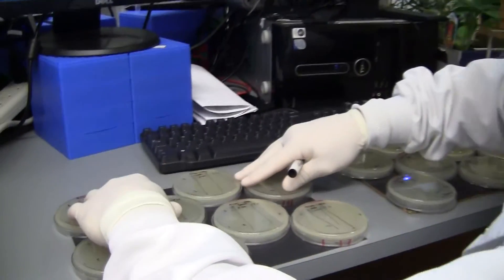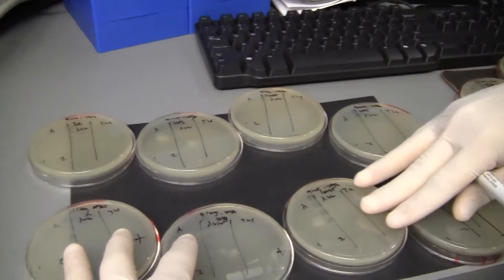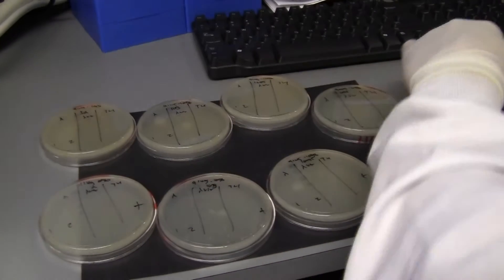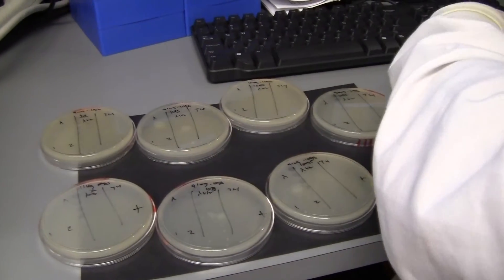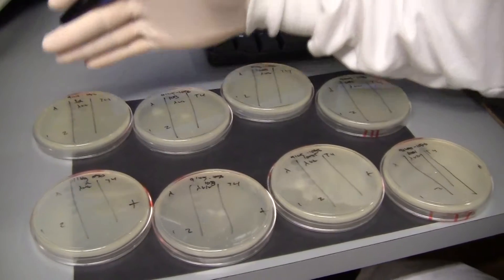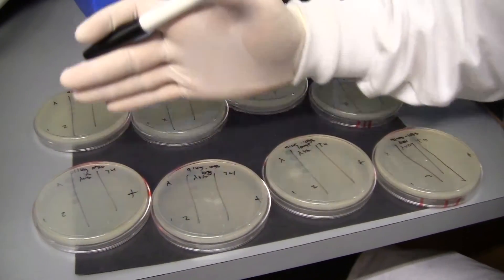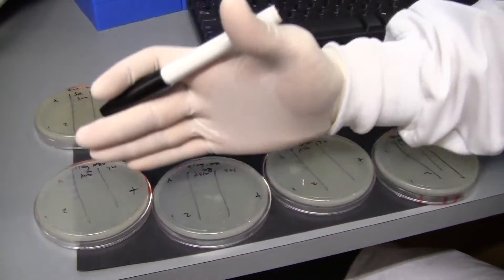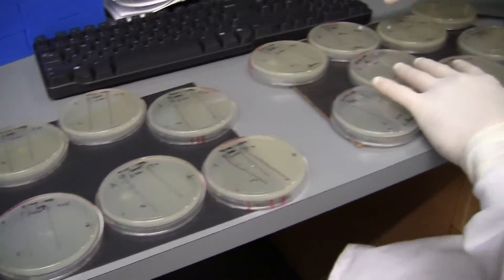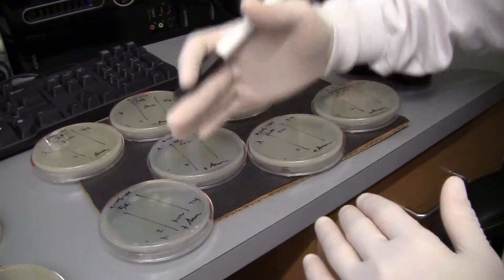I've taken our top agar plates and put them on these pieces of black construction paper — I do this because it makes them easier to see. We have two sets of plates: our C1 TRR fusion, which has an induced and an uninduced condition, and over here we have our T4M gene, also with an uninduced and an induced condition.